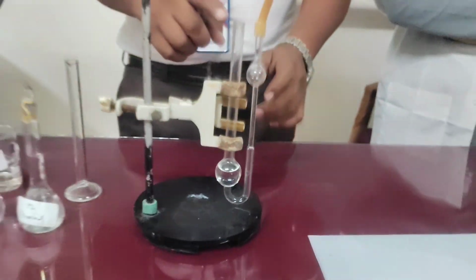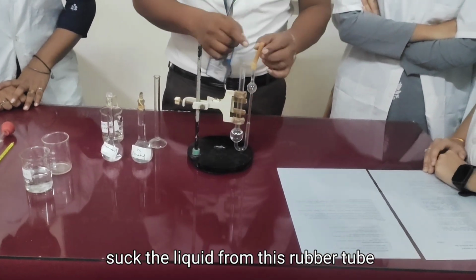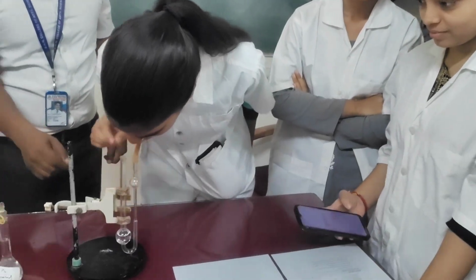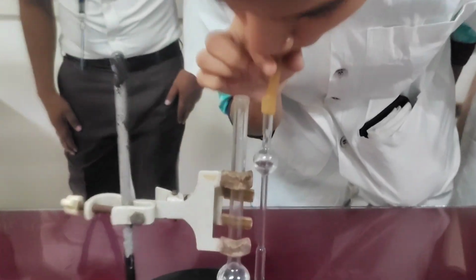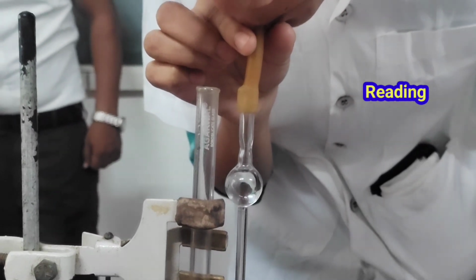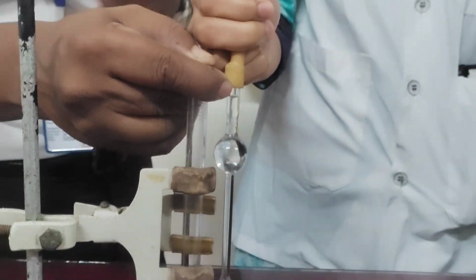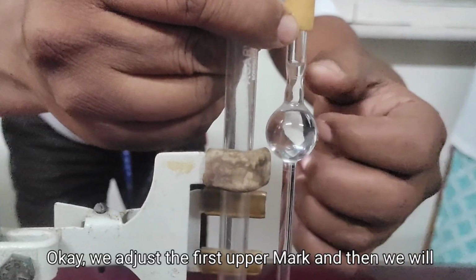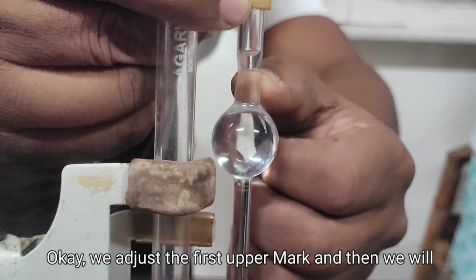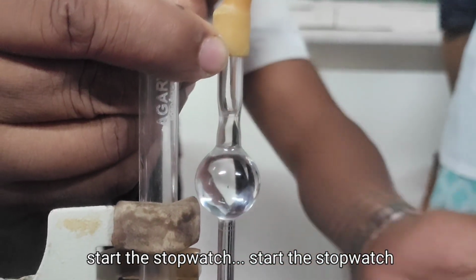And see, transfer the liquid from the lower bulb side and suck the liquid through this rubber tube. And where is the upper mark? This is the upper mark. Okay? So we will adjust it first and then start the stopwatch.